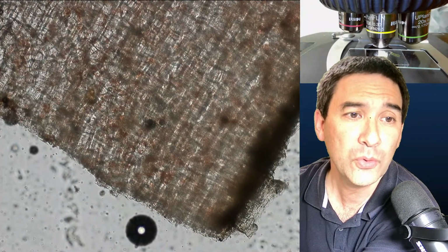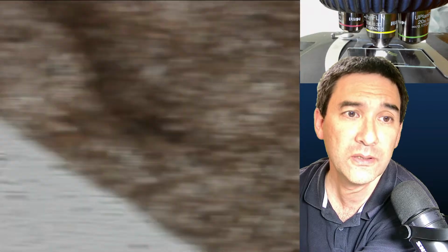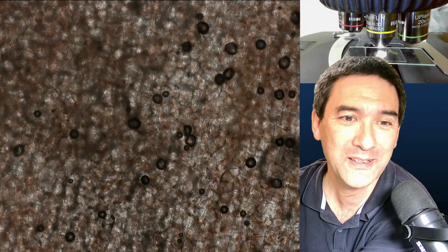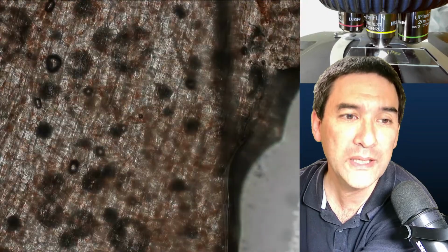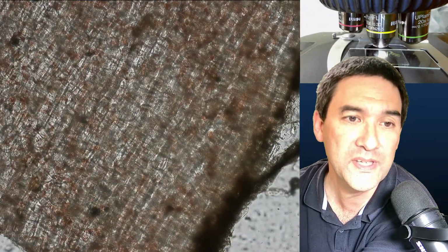Don't forget the specimens are quite stained as well. So this seems to be a fairly thick specimen. But if you focus, these are several cell layers, not the best cut. Okay, this is actually not really good. This is too thick a little bit. So maybe I should try a different one. But you do get the idea, and the carrot is also pigmented itself. Maybe it's 2 or 3 cell layers thick.